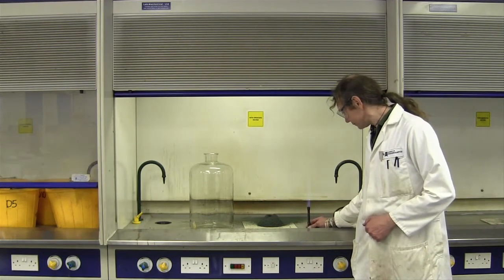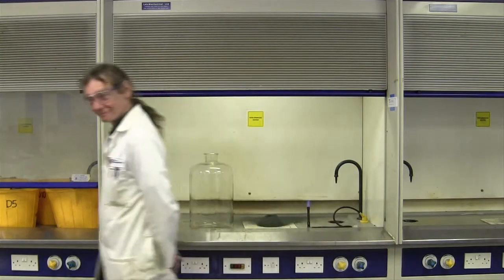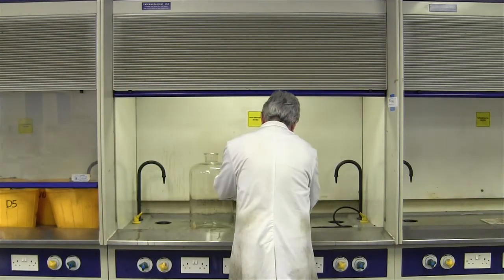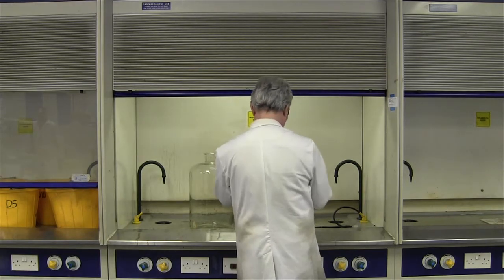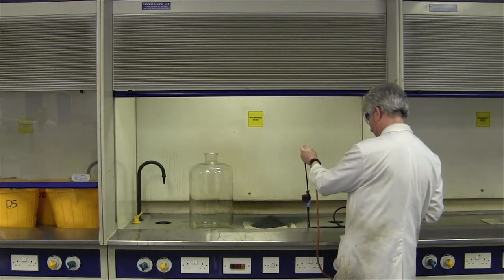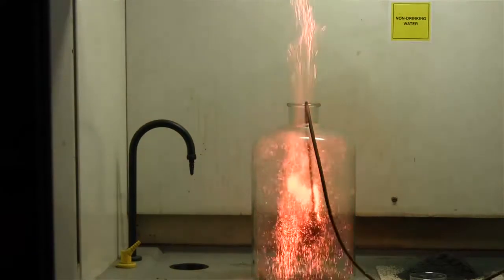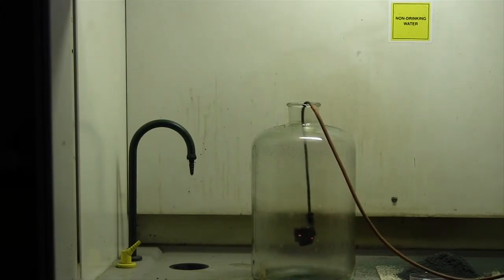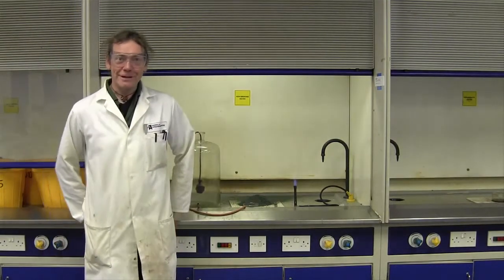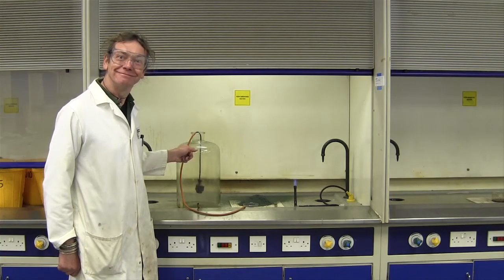Let's just turn the Bunsen up. Did it fizz or did it bang? No. It sparkled. Thank you.